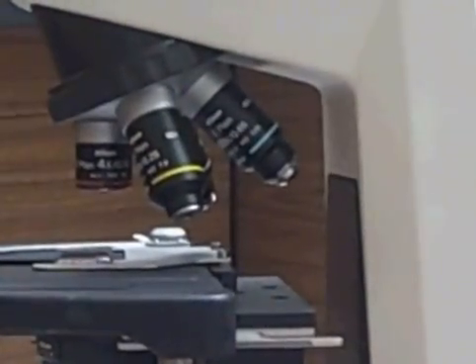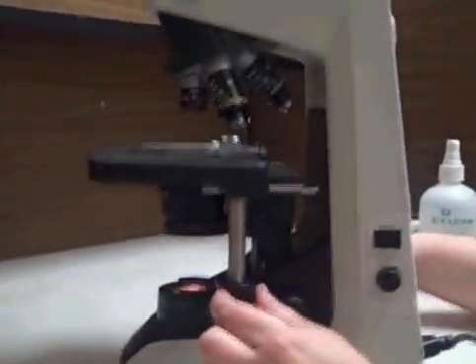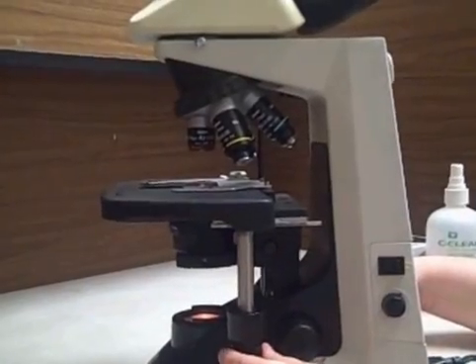Then, you're going to center your slide with the lower wheel side to side with the upper wheel back and forth, so that you're pretty much in the center of your slide.